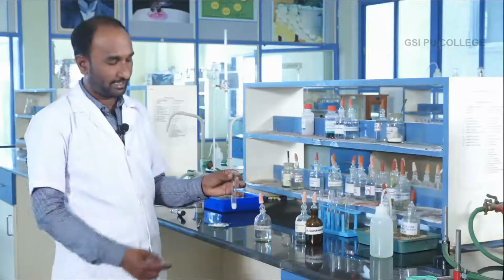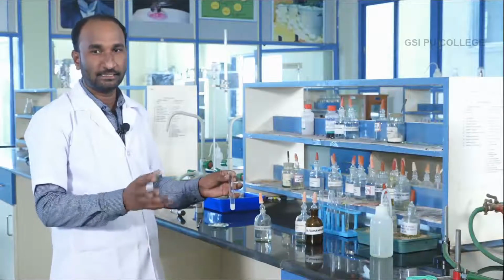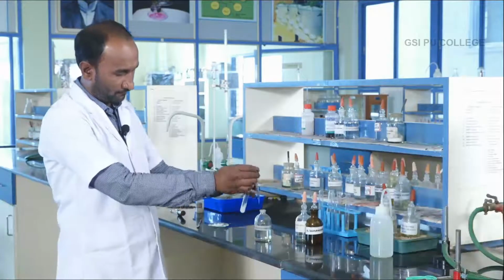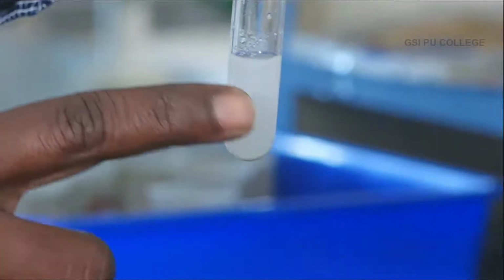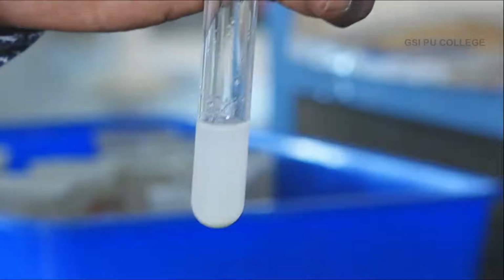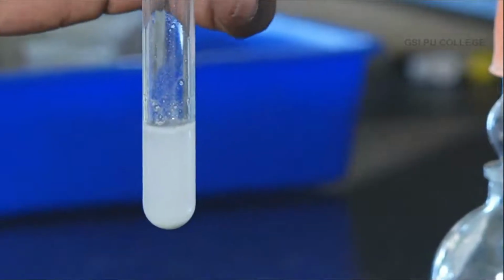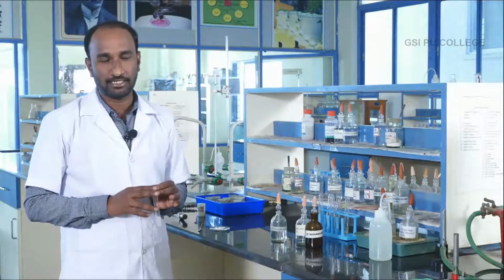The pale yellow precipitate is sparingly soluble in ammonium hydroxide, meaning it is not completely soluble. Add ammonium hydroxide solution. Let us observe, the pale yellow precipitate is only partially soluble, not completely soluble. Okay, Br minus is confirmed. This indicates that the given acid radical is bromide, Br minus.